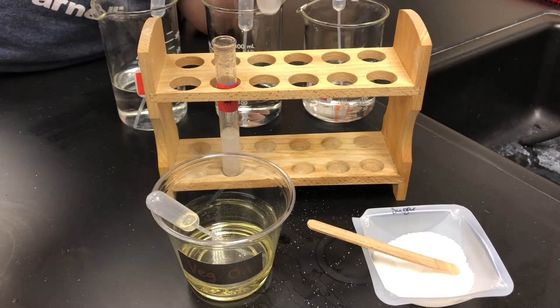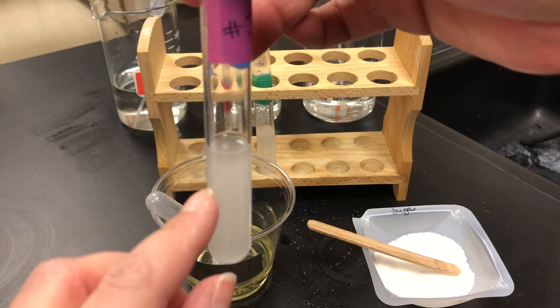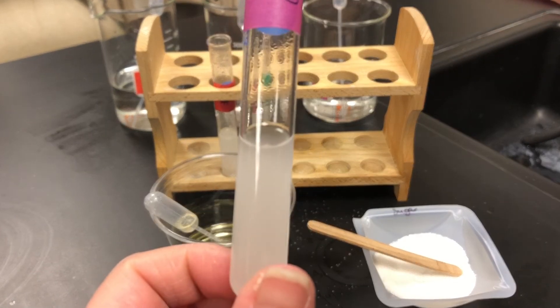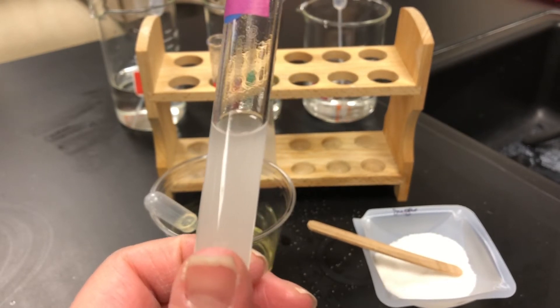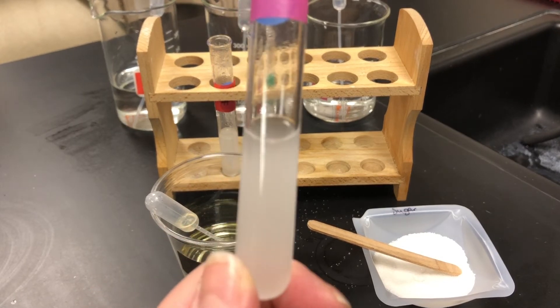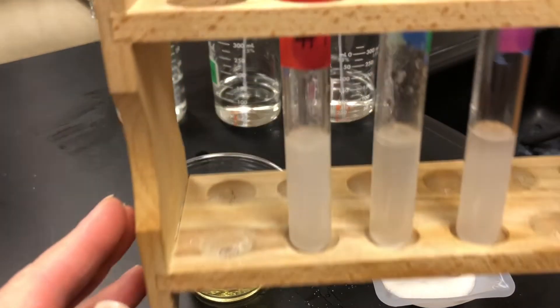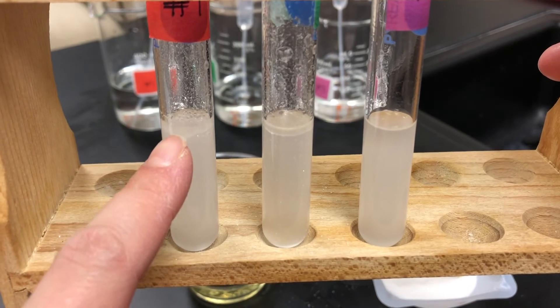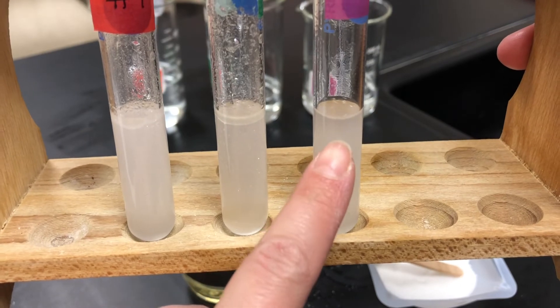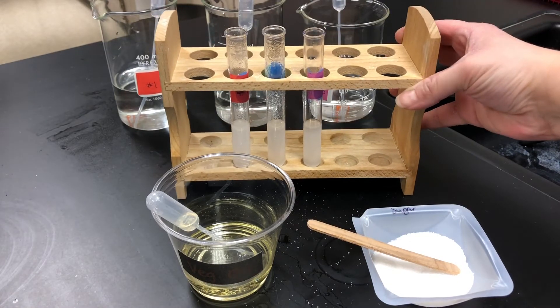We see an oily layer up at the top, which indicates that the oil is not mixed with this liquid. Now looking at test tube number three, there is no separation in the oil layer. Although it is cloudy, there are no oil droplets suspended in this liquid, which would indicate that the oil is soluble in this liquid, meaning that it did dissolve. If you look more closely at all three of them together, you can see a clear separation in the oil layer for liquid number one and liquid number two, but not for liquid number three, which indicates that oil is soluble in liquid number three.